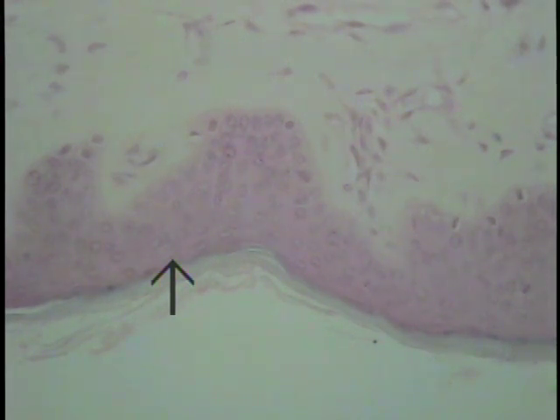In this particular case, the epidermis, these cells undergo a metamorphosis or a transformation and become keratin, a proteinaceous material that covers the surface of the epidermis. When this condition arises, this prefix of keratin is placed on the classification scheme. Therefore, this type of epithelium is referred to as a keratinized stratified squamous epithelium, as opposed to that lining the esophagus or the vaginal area, which is a wet or a non-keratinized stratified squamous epithelium.